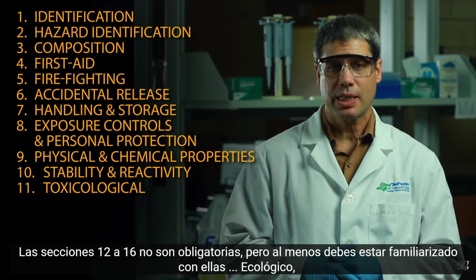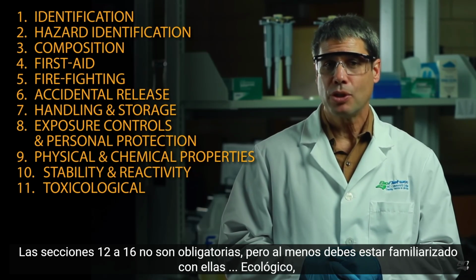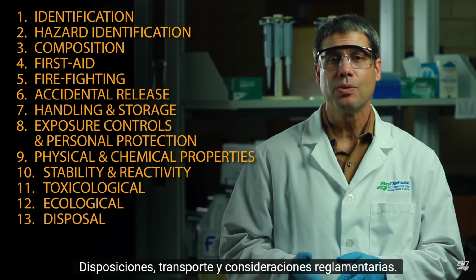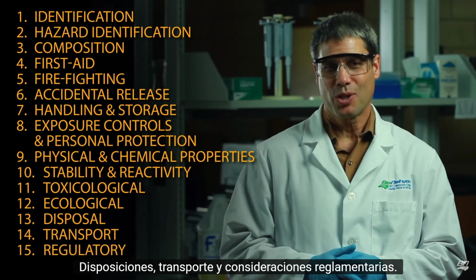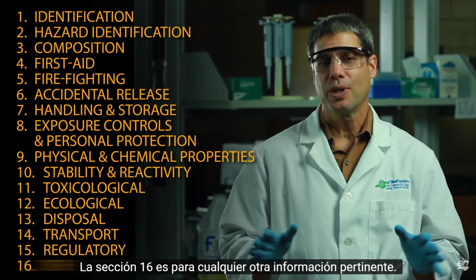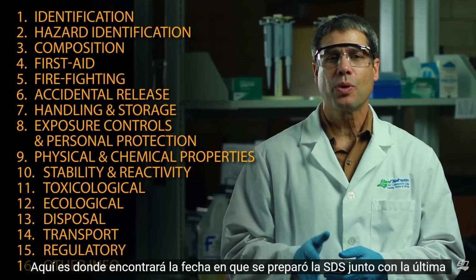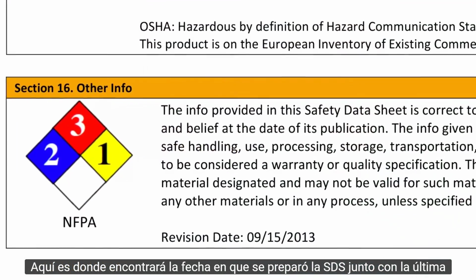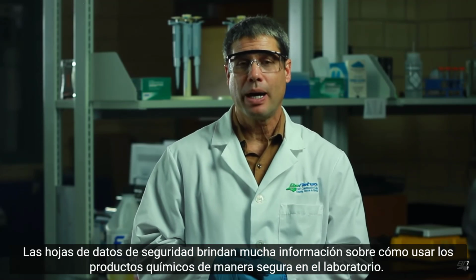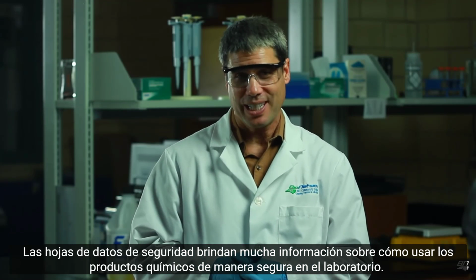Sections 12 through 16 aren't mandatory, but you should at least be familiar with them. Ecological, disposal, transport, and regulatory considerations. Section 16 is for any other pertinent information. This is where you'll find the date that the SDS was prepared along with the last known revision. Safety data sheets provide a lot of information about how to use chemicals safely in the lab.